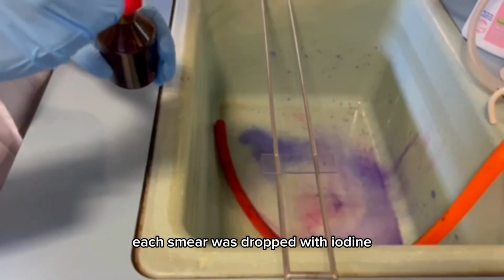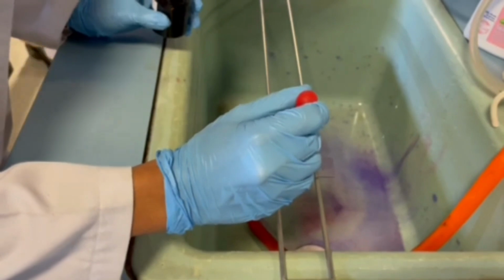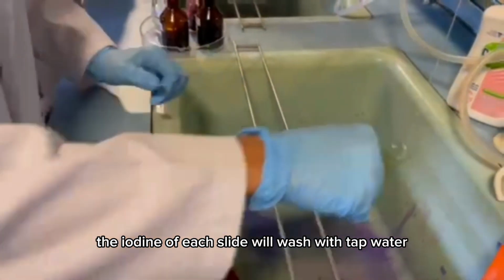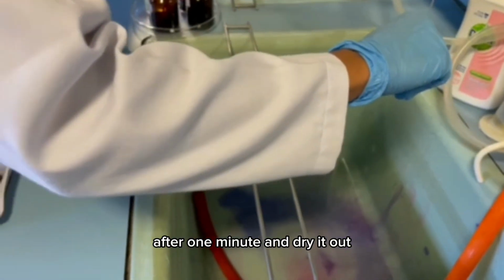Each smear was dropped with iodine. The iodine on each slide was washed with tap water after 1 minute and dried out.